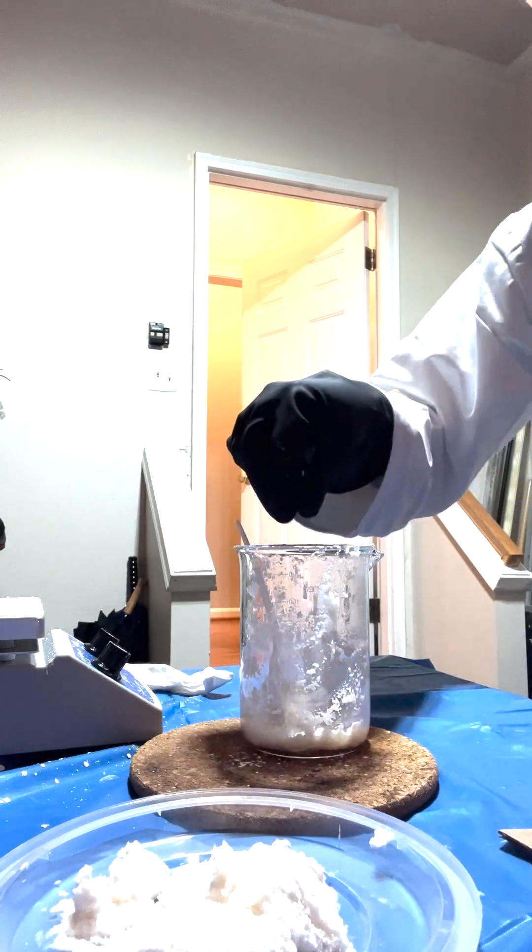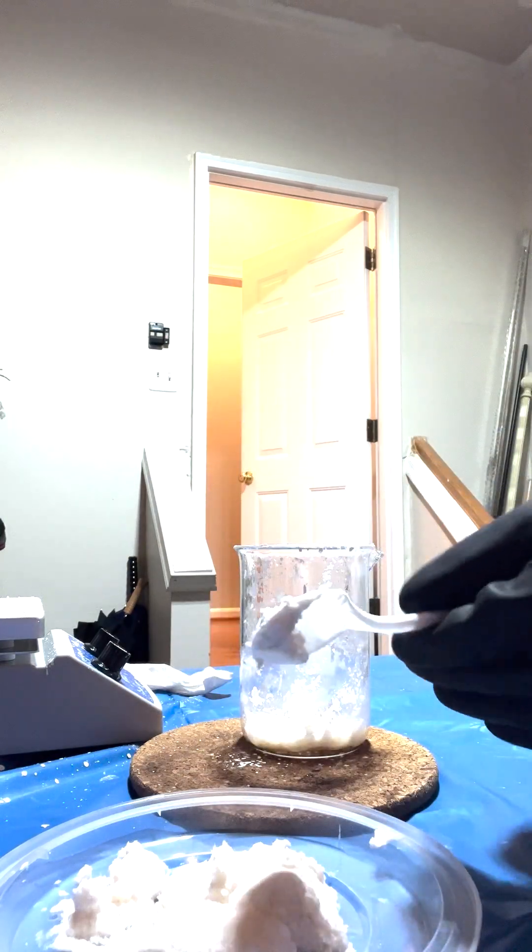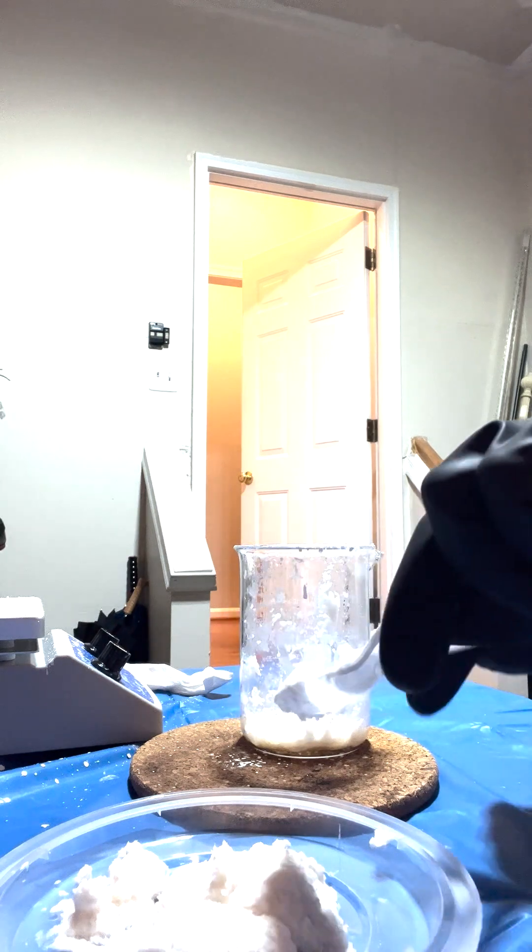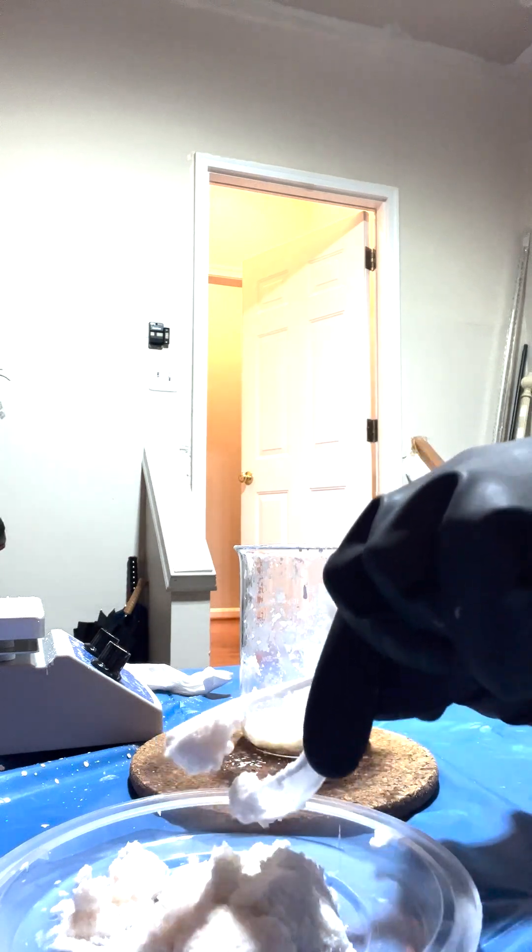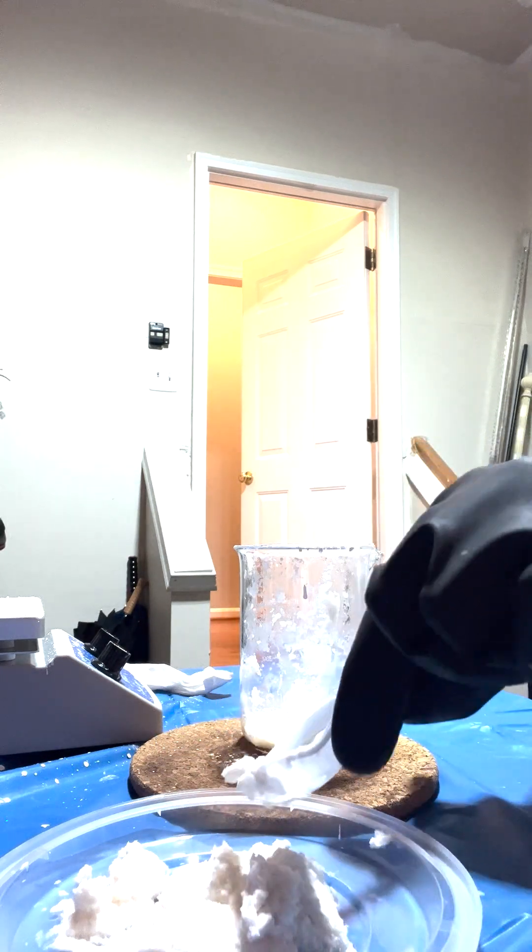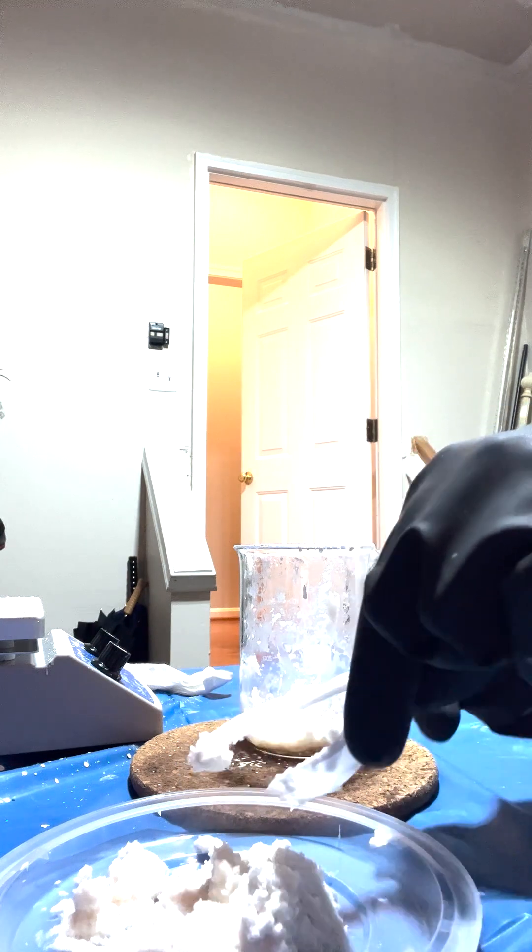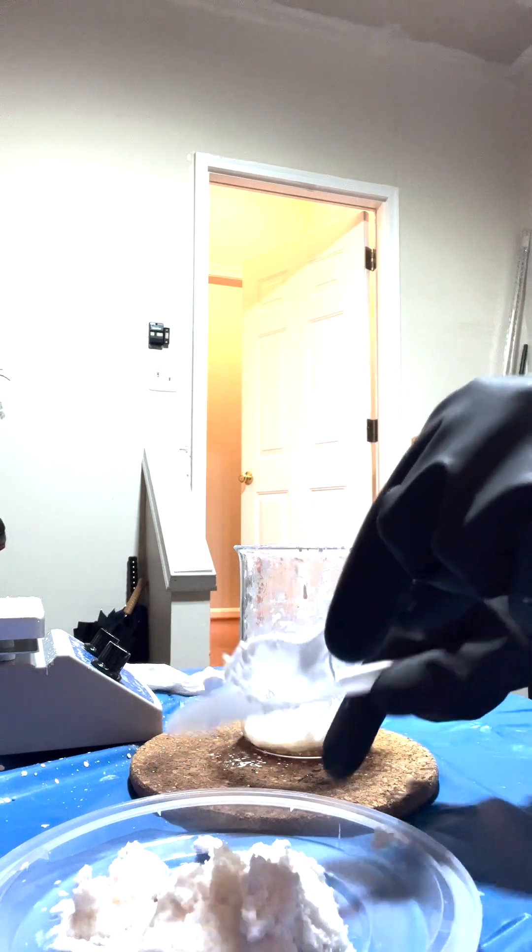Right? And with that, taking out the last piece of our acetate, and this should only take a couple hours to just dry, and then once it's dry, I can crush it up, and we have our powder.